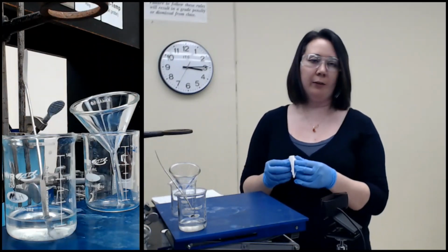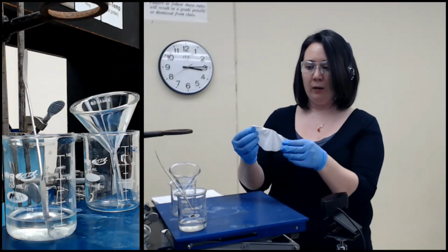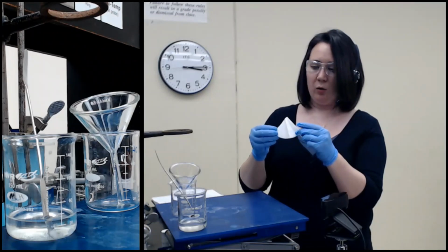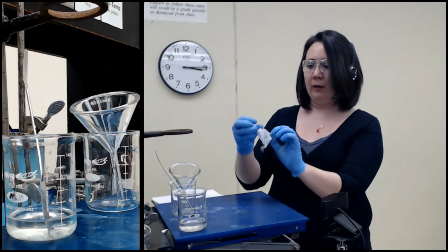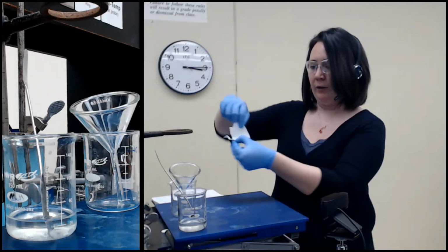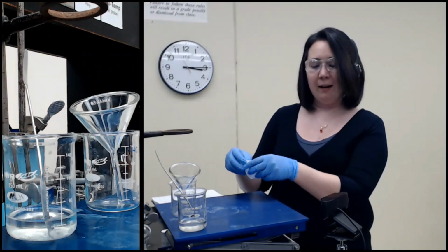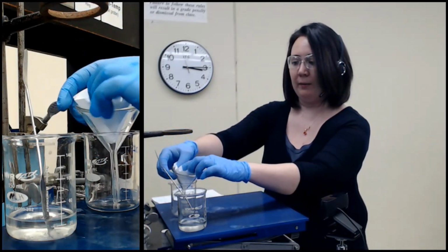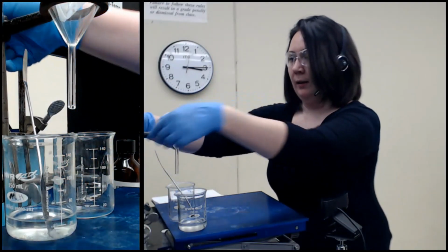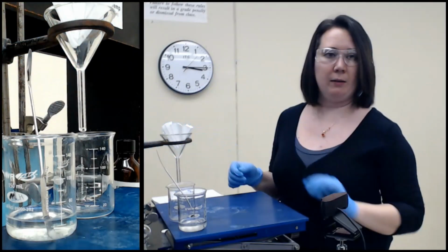If you don't have fluted filter paper, you can still use just regular large circle filter paper. You fold it once into a semicircle, fold it again into quarters. It's a bit hard when it's already fluted. And then just open up the little pocket you've created. Personally, I prefer that to the fluted filter paper myself because it fits a little better into these smaller funnels, but that's okay. So I'm actually going to take advantage of this ring I have set up for the next step and just put that right there.